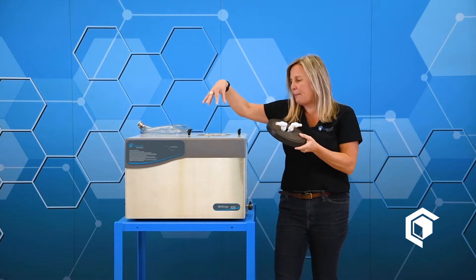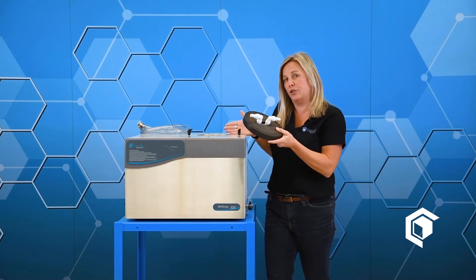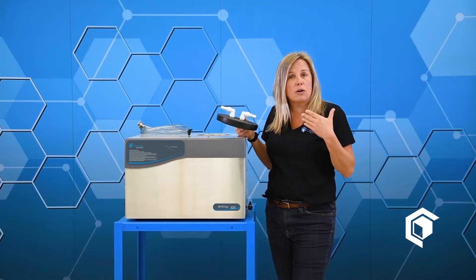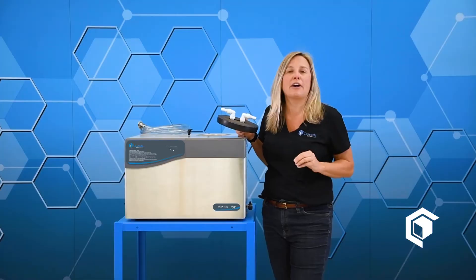The trapping itself is going to happen inside the stainless steel reservoir on the refrigerated base unit. If you purchase this cold trap standalone, it would not come with any hoses or connections, but should you need those we have definitely got you covered — just give us a call and let us know what you need.